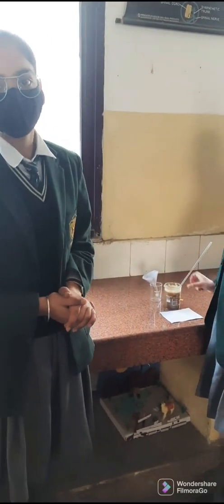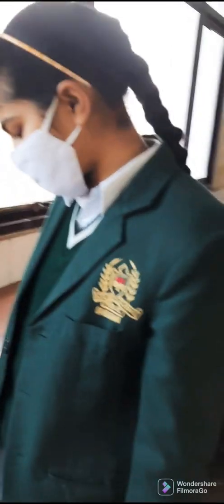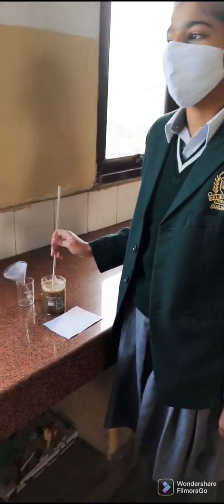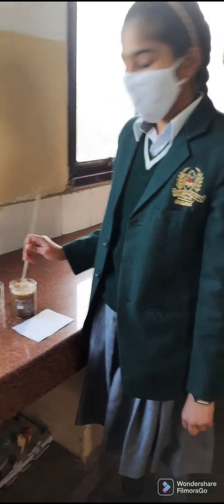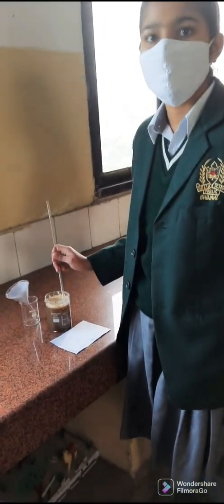Hello, good morning everyone. This is Sonia Kaushik, and today we are in our bio lab. Let's see what experiment students are doing today. Students have taken soil from a crop field, near the roots of plants.